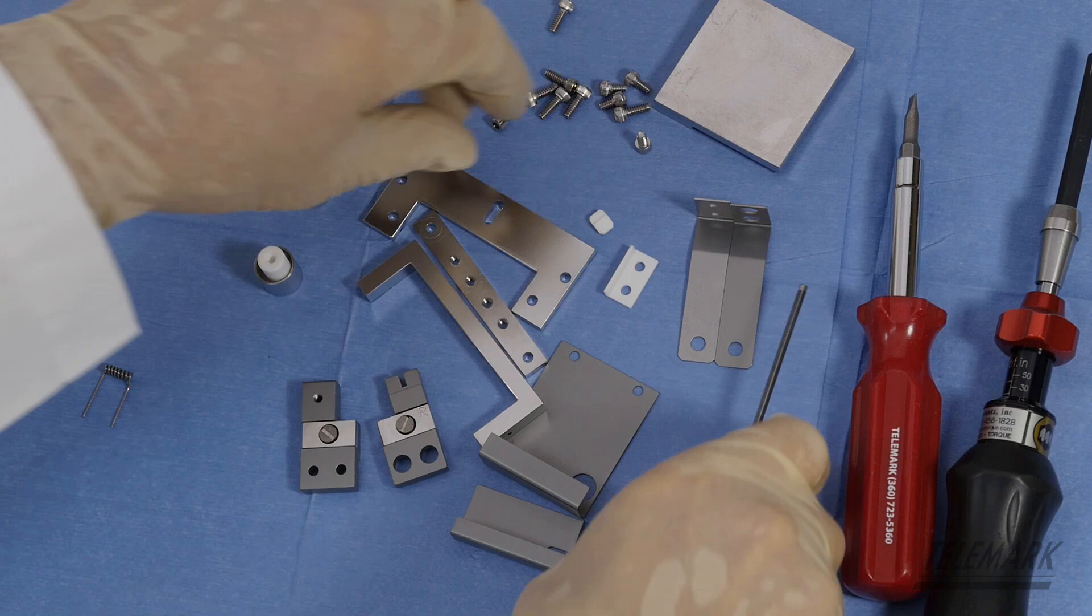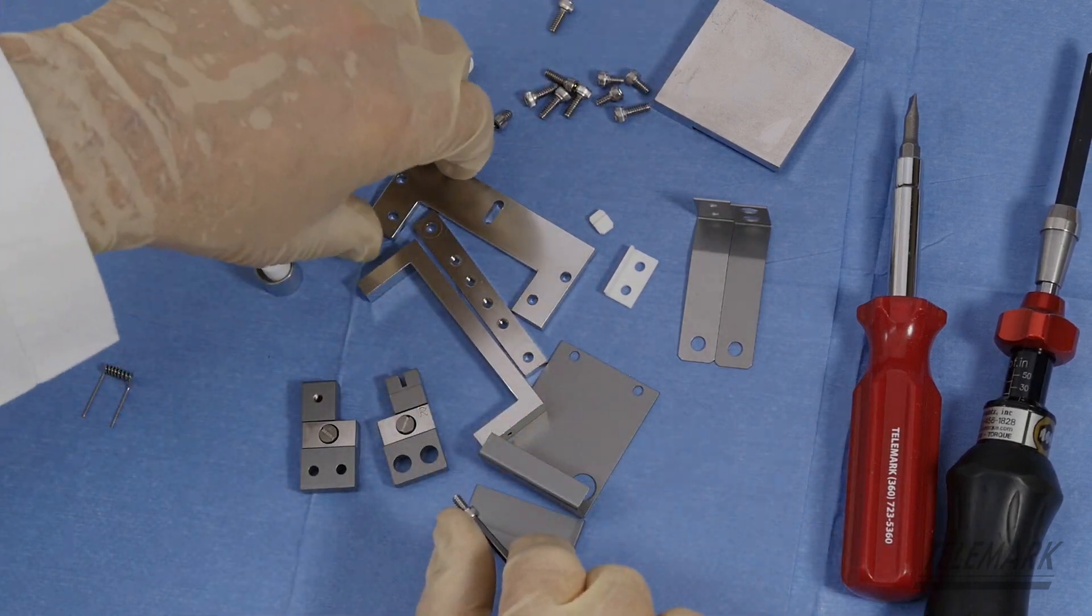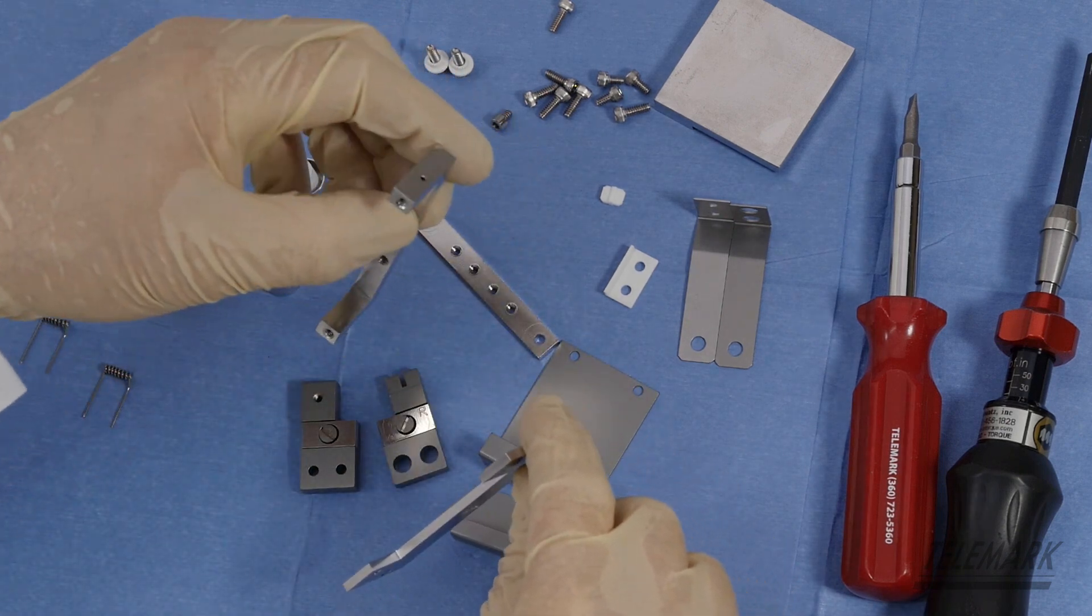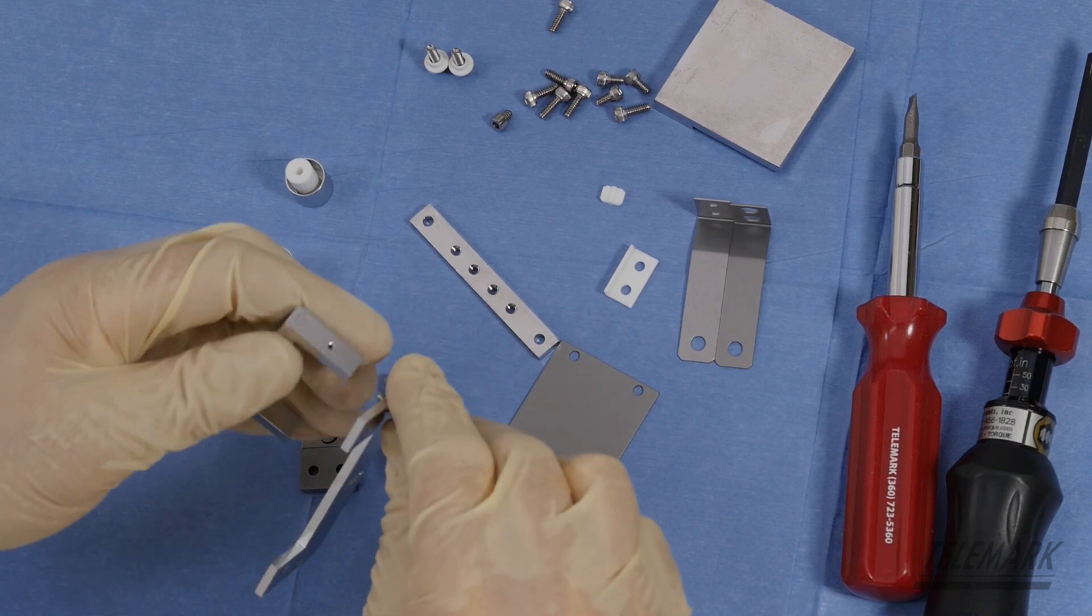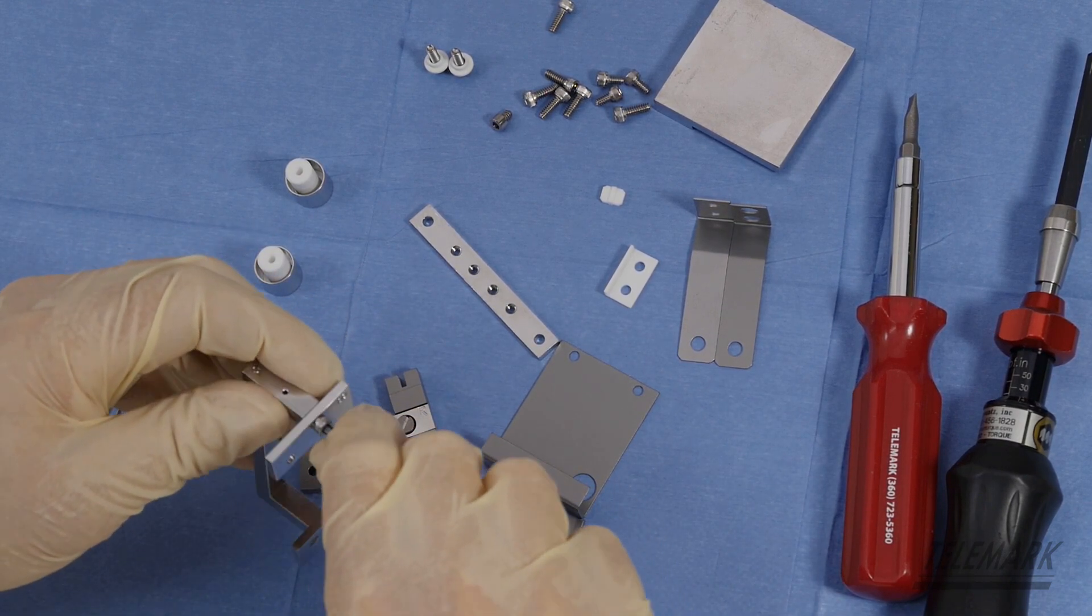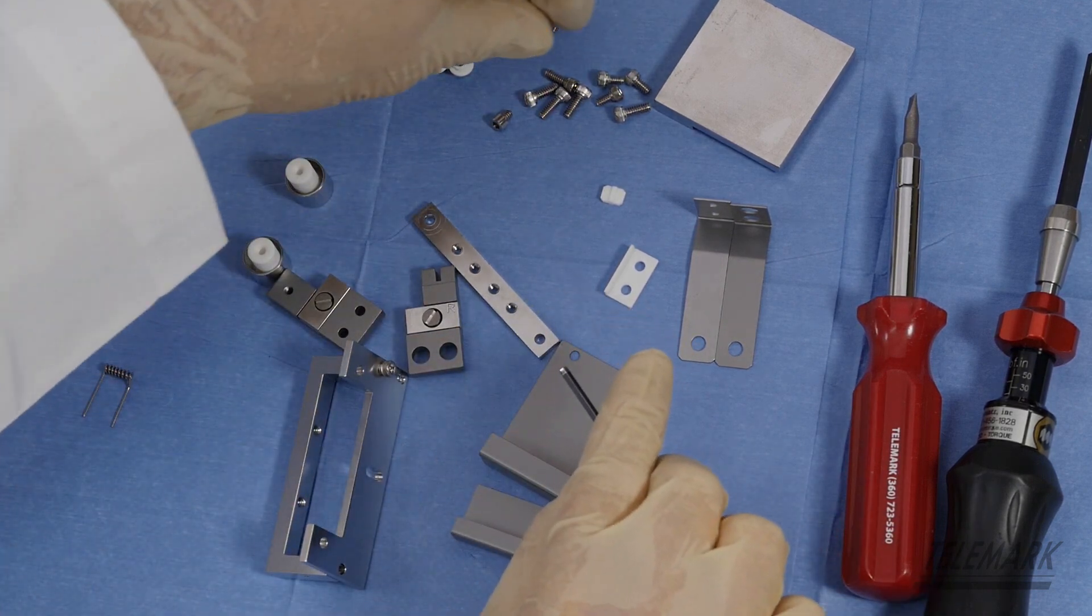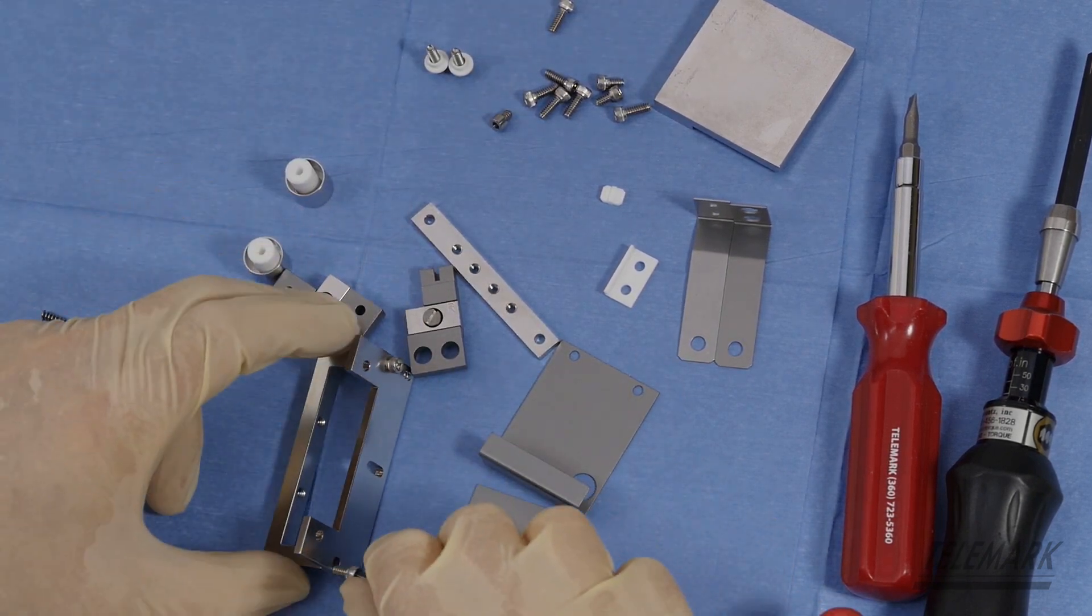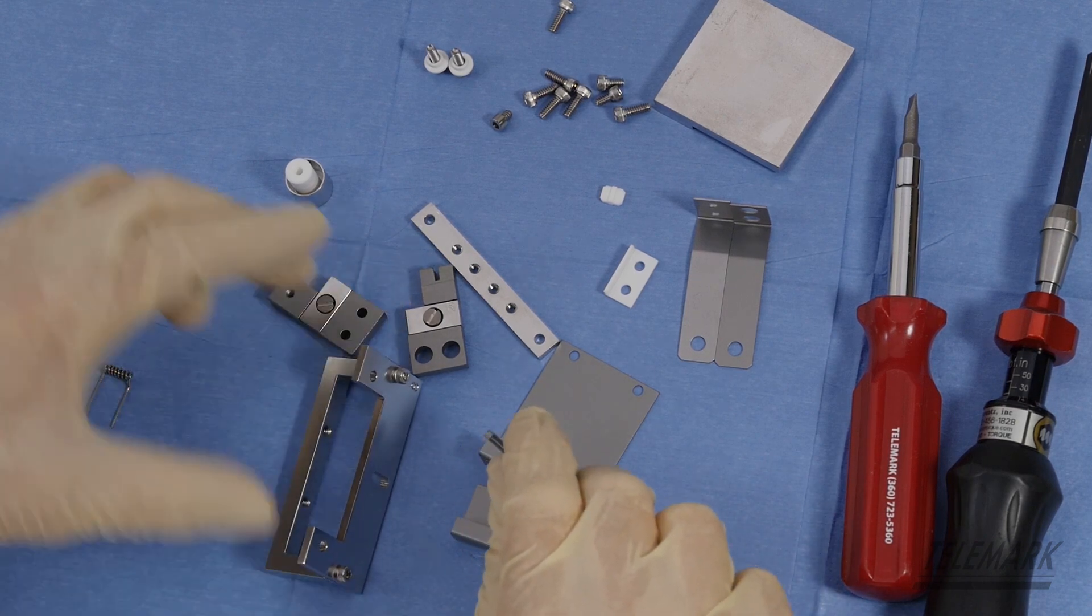Maybe find one of your 632 by 1/4 inch screws in your mount bracket. Then you've got a U bracket and it's got an eight on one side. You want to kind of line them up because there's an offset to the bracket, to the U bracket that you don't want to lose. And 632 again by 1/4 inch. Just get them started. You don't want to tighten them down. Just get them snugged into place.